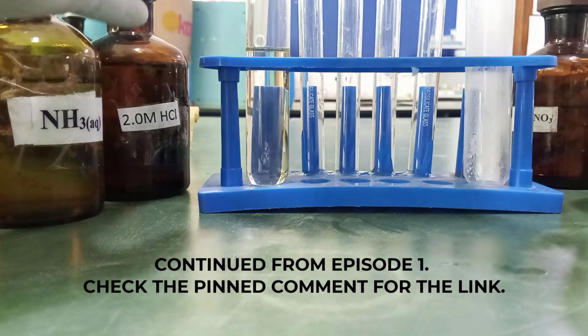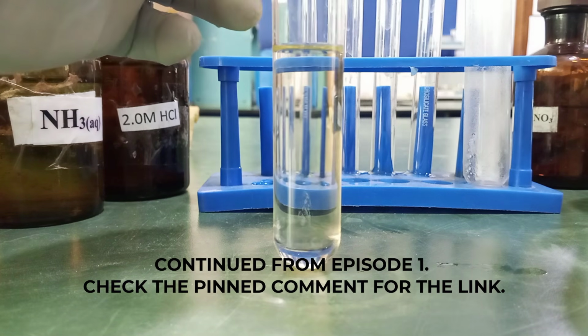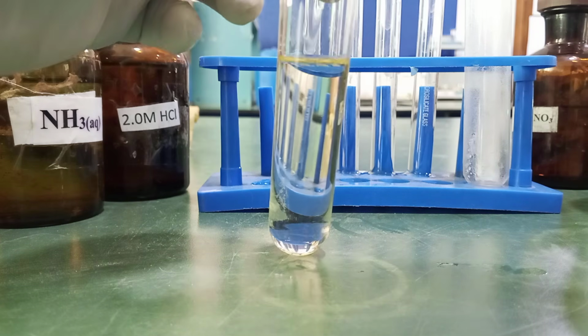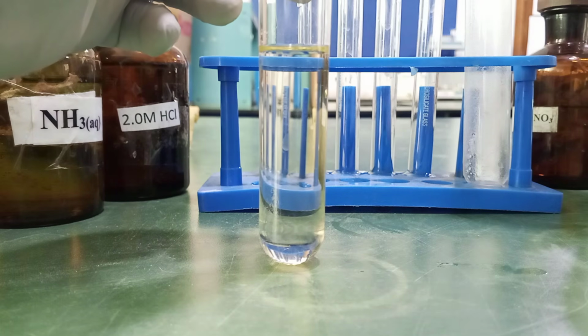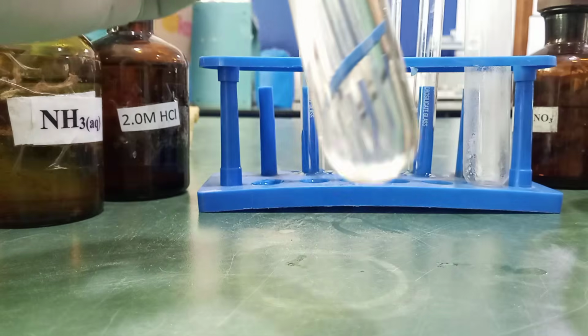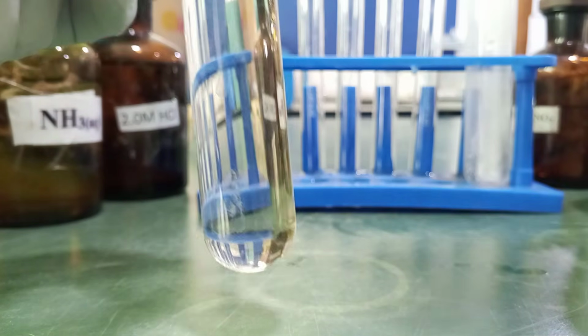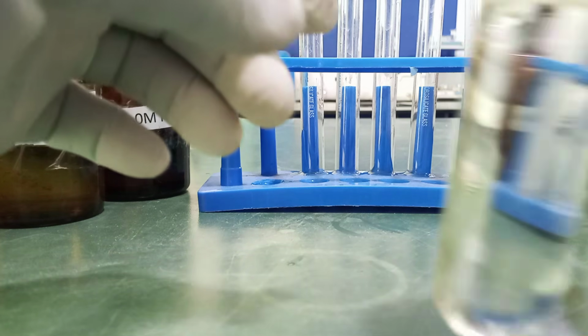So it seems our filtration is almost complete, but there are still some drops of the filtrate. So what we'll do is we'll transfer this here. I like to continue dropping because I don't want any part of the filtrate to interfere with the analysis of the residue. So we're going to carry out the analysis of the filtrate.